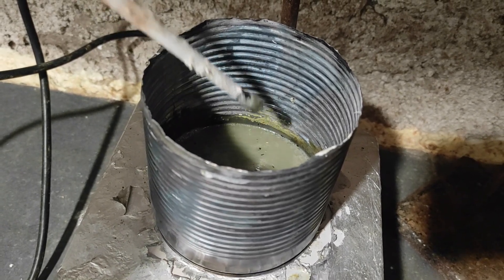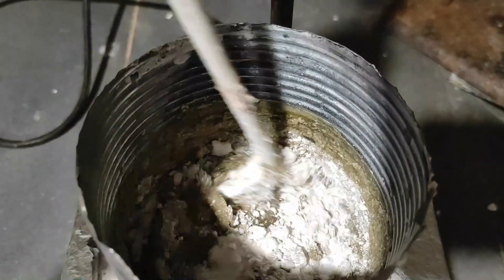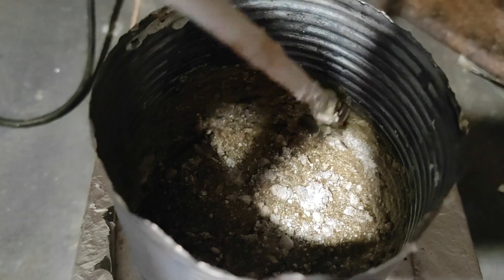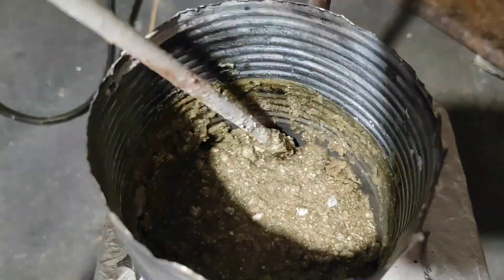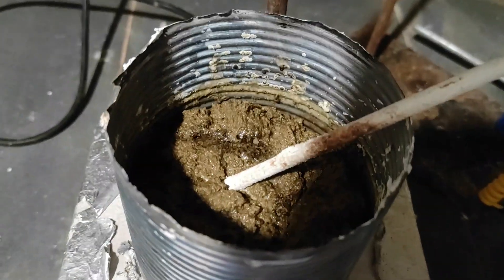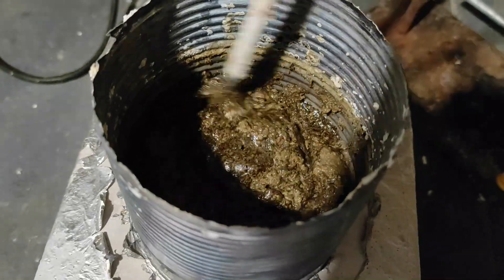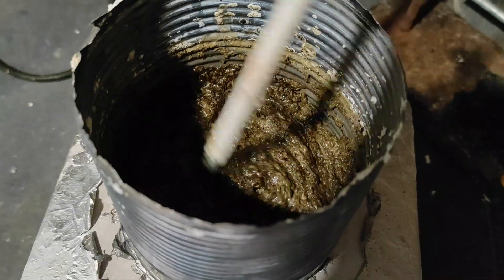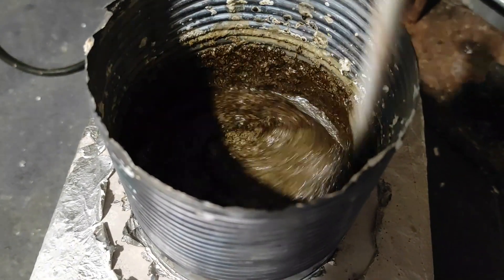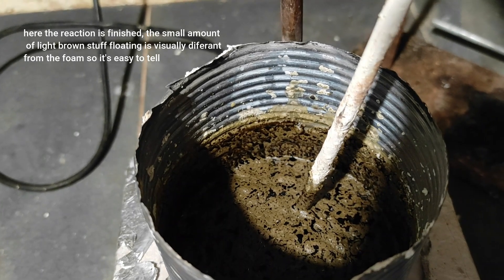Then you can start the additions — you add the 15g and then the rest, basically adding it in portions when the mix is thin enough to stir. Then just stir it vigorously until it gets somewhat homogeneous. It forms a sort of paste that gets pastier when you add some solid, but it gets thinner over time when heating. After the additions are finished, and with enough heat, the mixture should form a sort of weird dense foam on top at about 300 degrees. This is not the end point yet — you need to heat it even more until about 330 degrees. You don't really have to check the temperature, because the dense foam will suddenly disappear and some gas bubbles will start to form. At this point the mix is entirely black, which is also expected — even with pure reagents it's normal — and then you can stop.